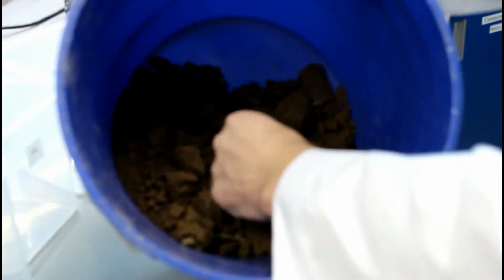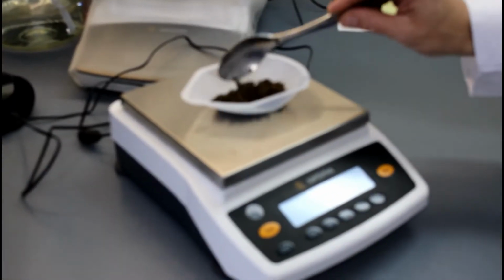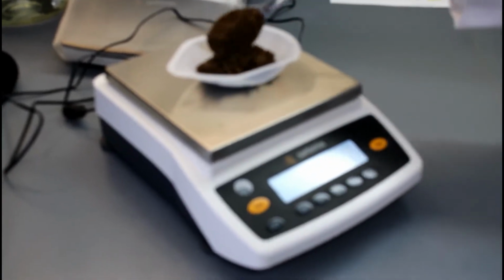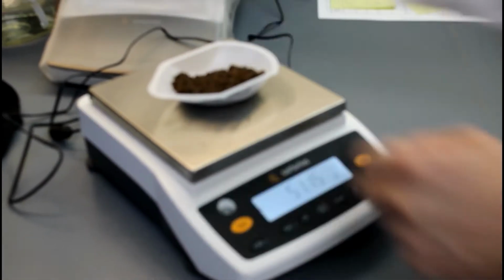It is important to remove the visible roots and plant fragments that we can see in the soil samples before repacking the soil into the microcosms, and to carefully homogenize the soil together without causing too much disturbance in it. The amount of soil to be put in each microcosm will depend on the moisture of the soil samples and the aimed bulk density to be fixed in the microcosms.